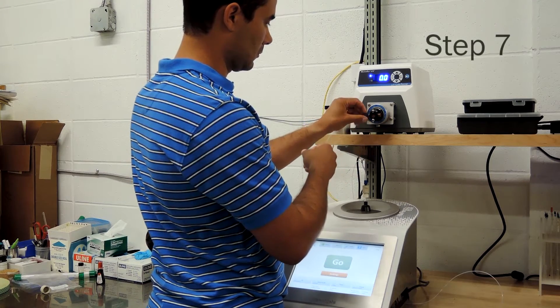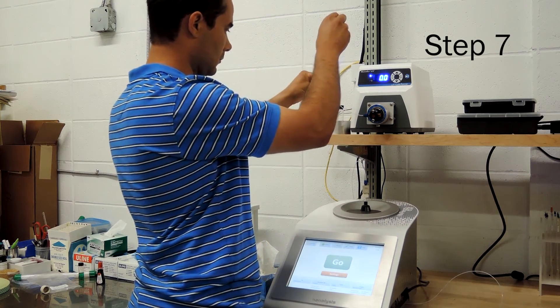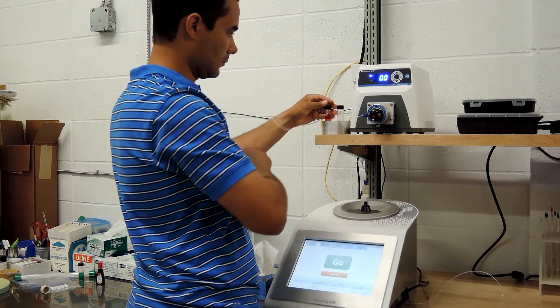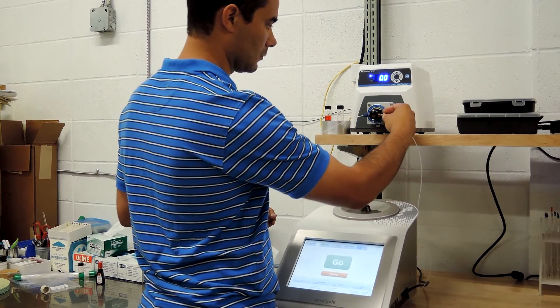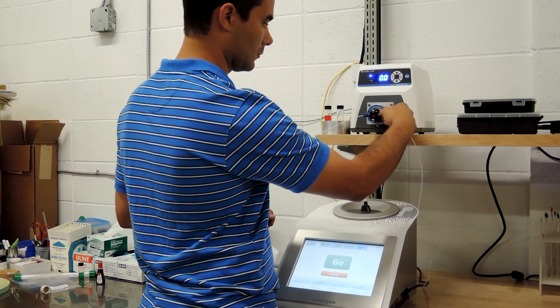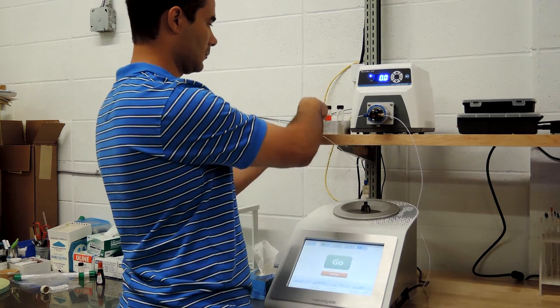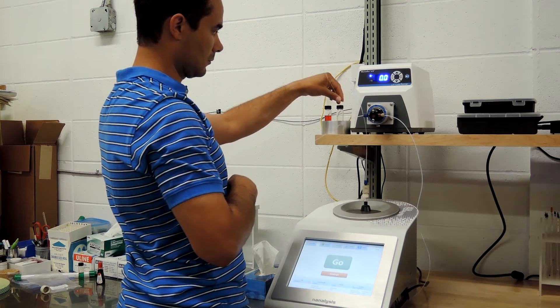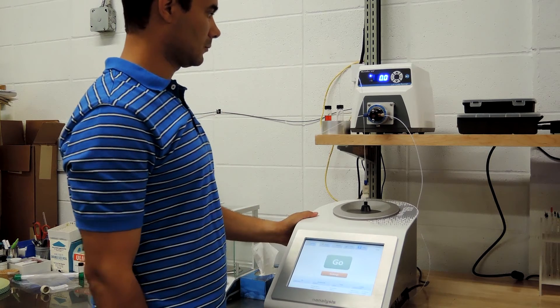Once it is connected, you now have a sealed vessel around the glass tube and you can connect the chromatography tubing to the top to complete the loop. For this demonstration we are using a metering pump, so we will first route the tubing from the reaction vessel to the in port of the pump. You could also use an HPLC pump or syringe pump depending on your personal preference. Now we connect tubing from the out port of the pump to the base of the spectrometer. The tubing from the top of the spectrometer can be connected to a waste vessel or back into your original vessel, again depending on your personal preference.